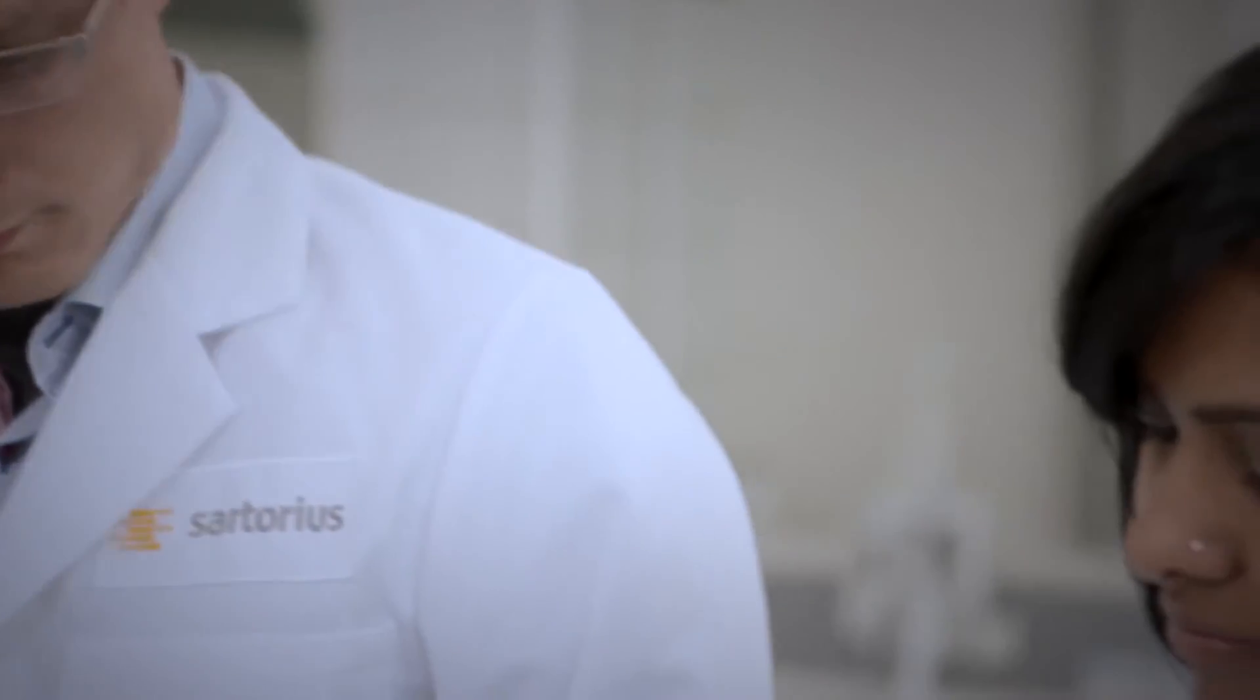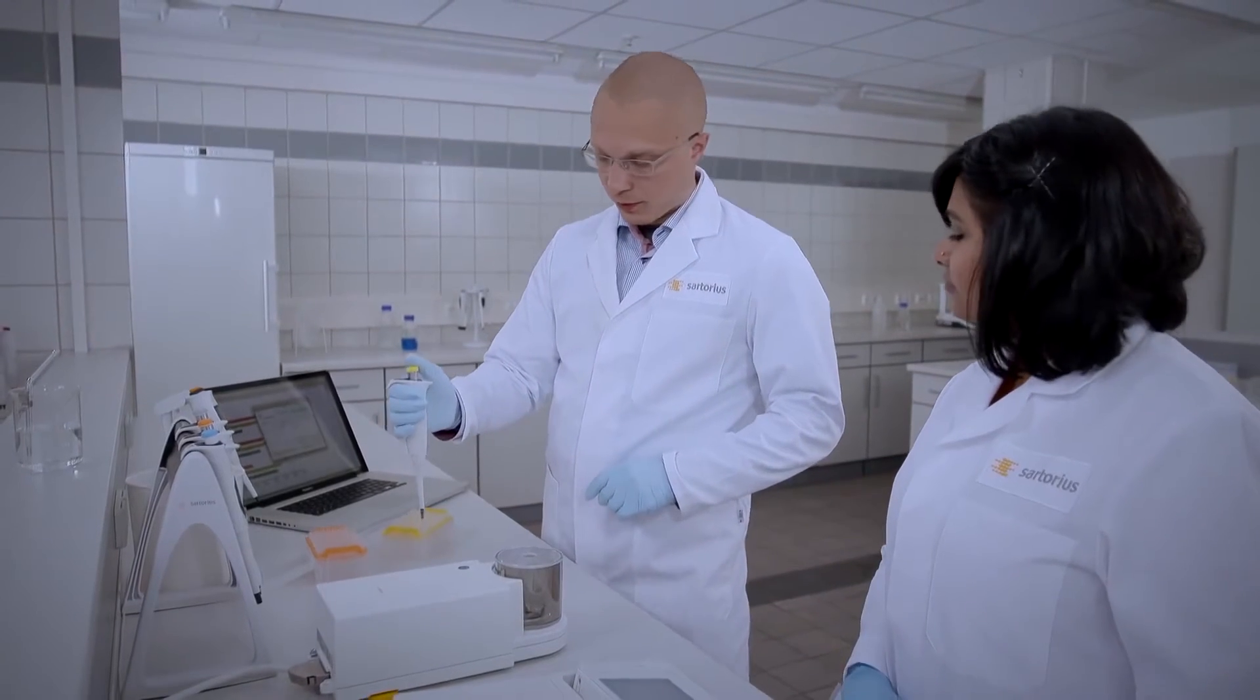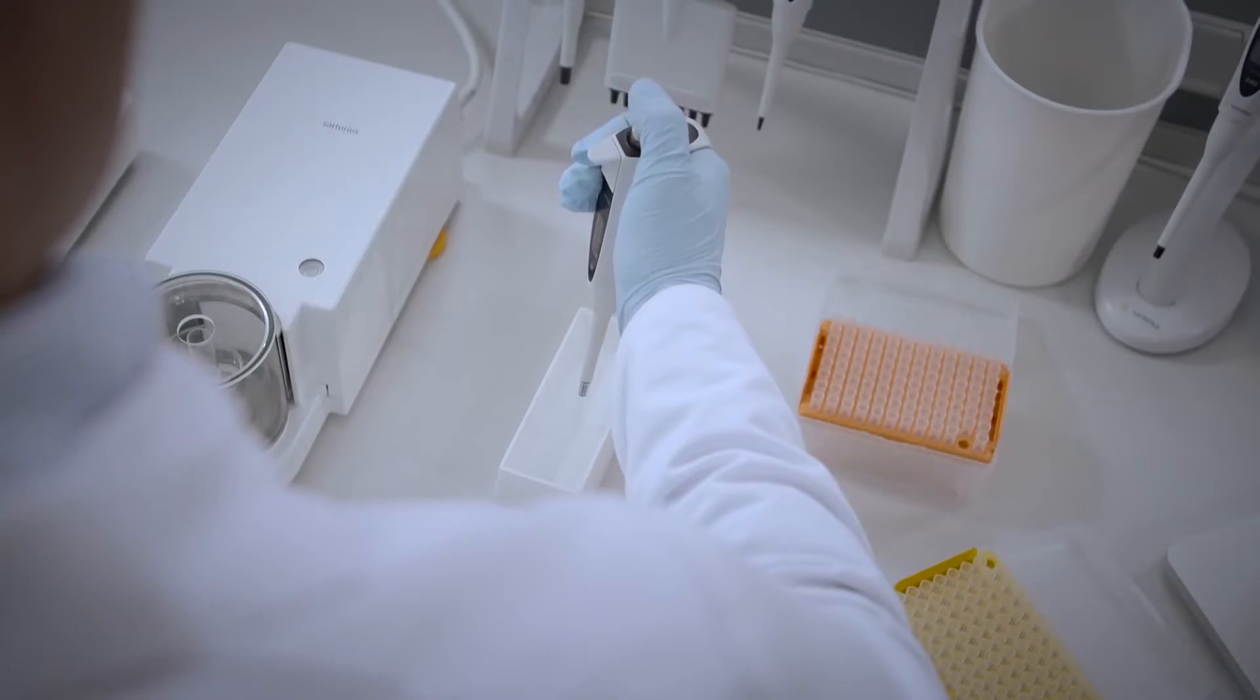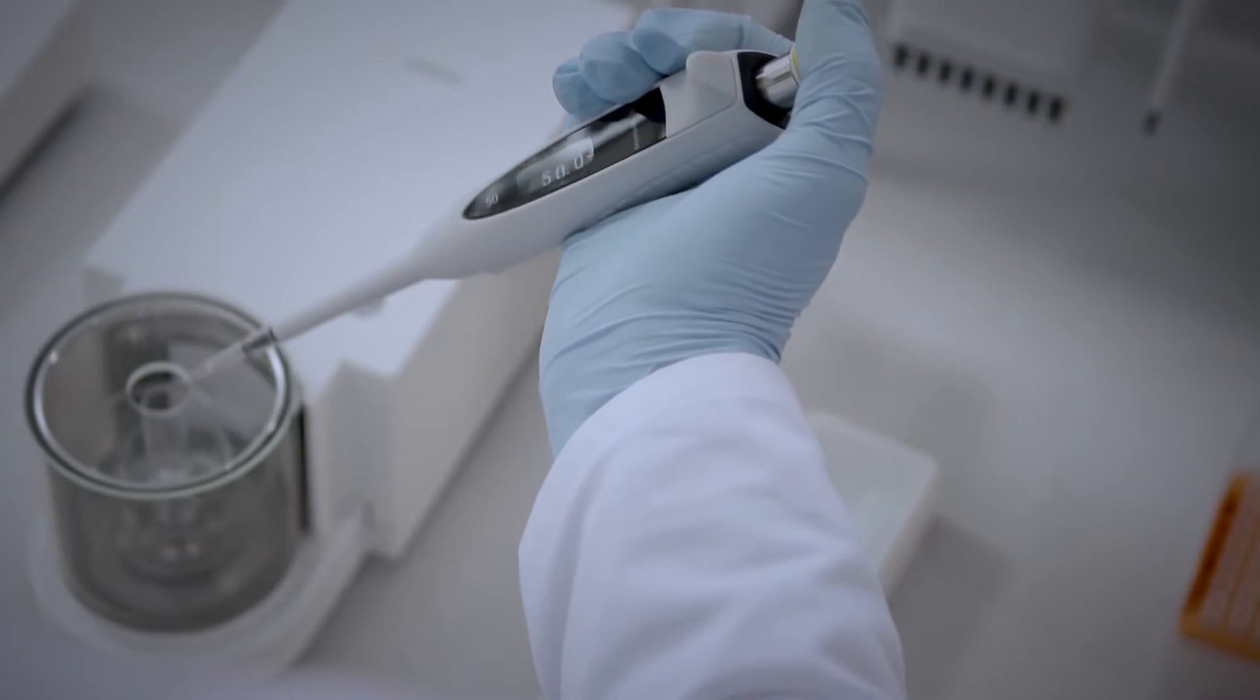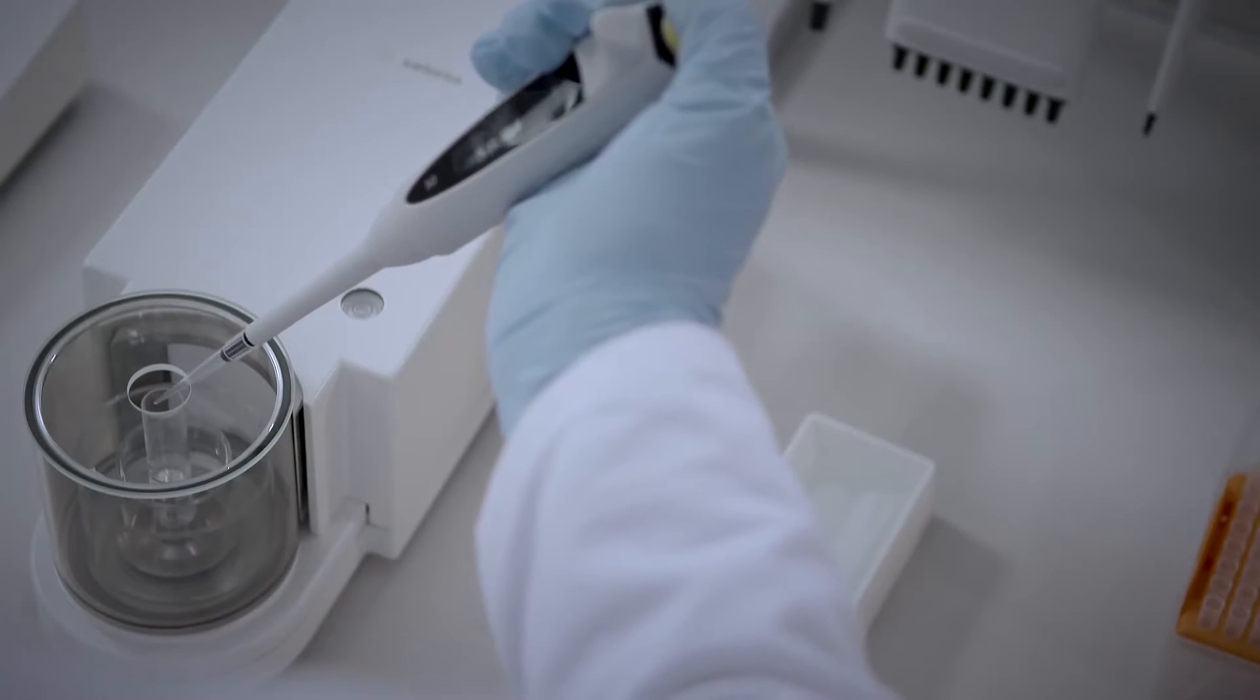The most important factors to remember when performing pipette calibration are to pre-wet the pipette, hold it vertically when aspirating liquid, and to position it at a 45 degree angle when dispensing into a vessel on a balance.